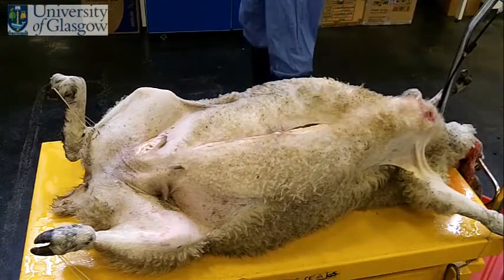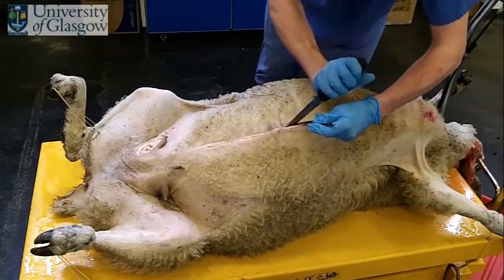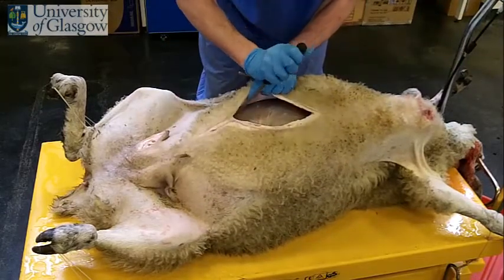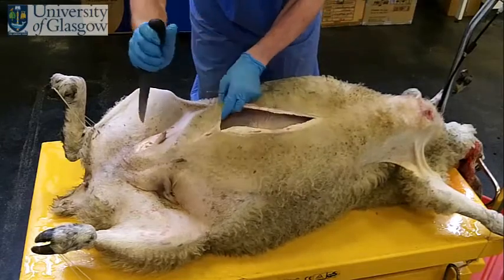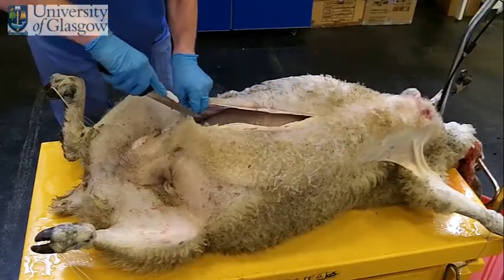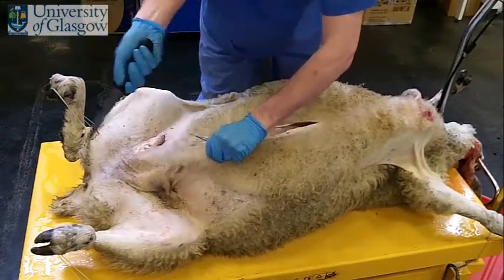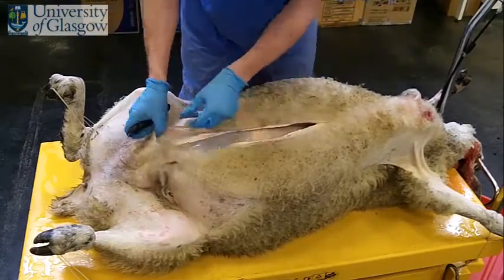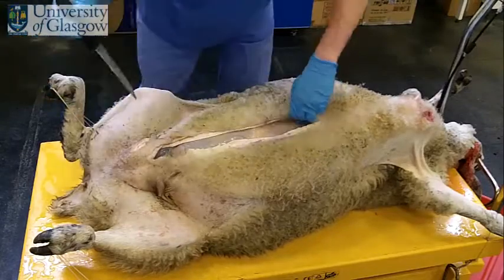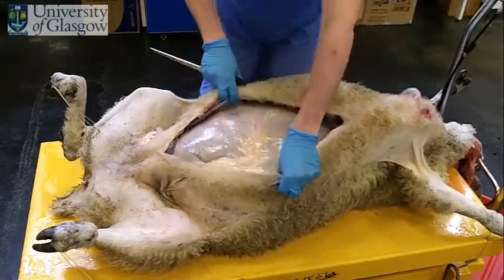Now that I've opened that one wall up a bit, I'm now going to introduce the knife and cut through the body wall. Then extend the cut cranially, again up to the xiphisternum. Now you can see the ventral surface of the stomach.